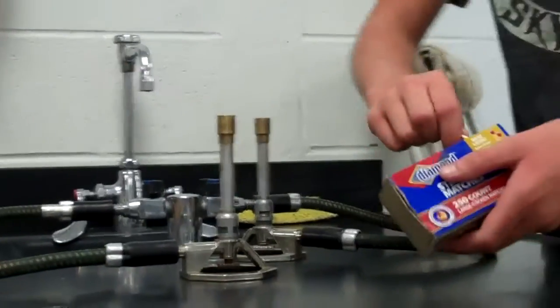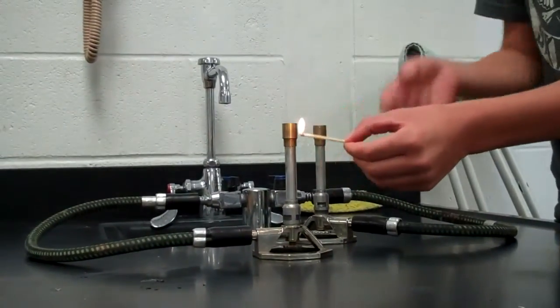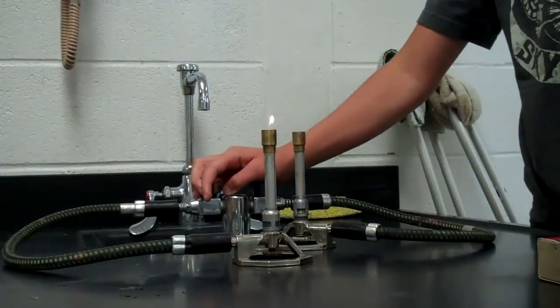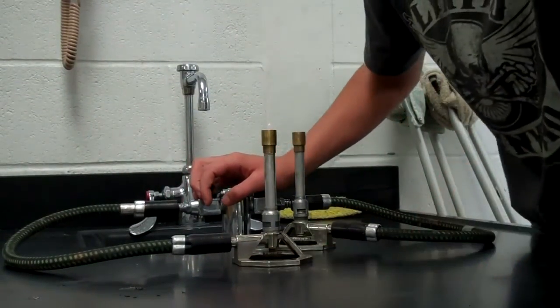Second, you have to strike the match. Hold it next to the Bunsen burner and turn on the gas to 180 degrees. Make sure you put the match out of the way once you're done.